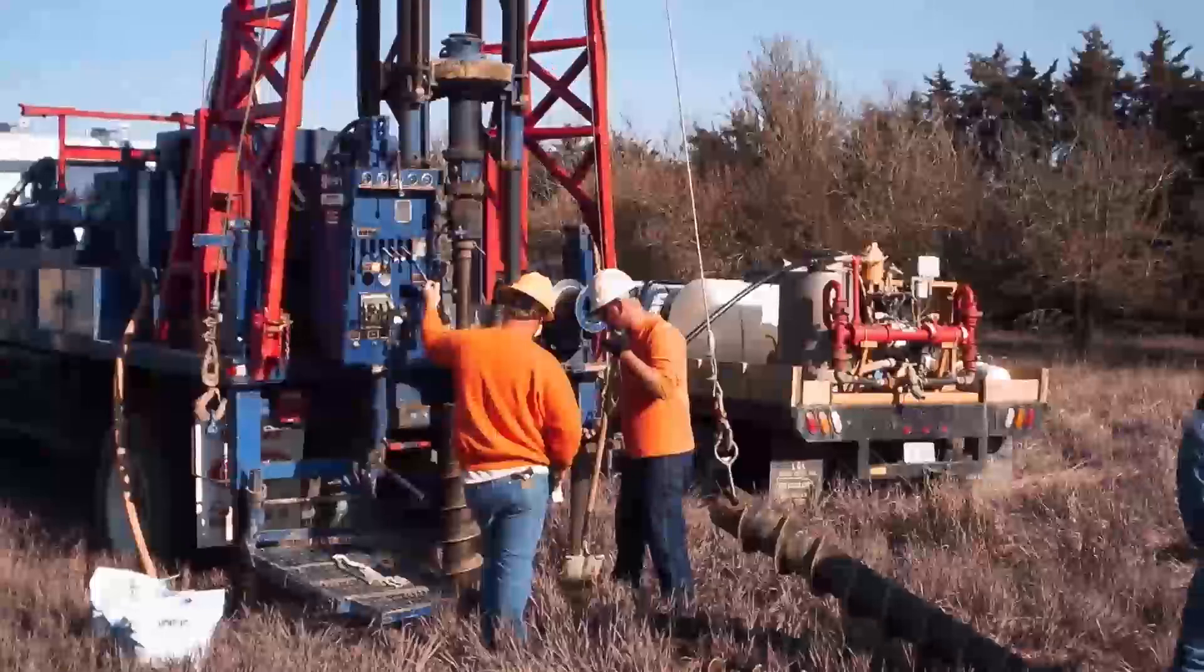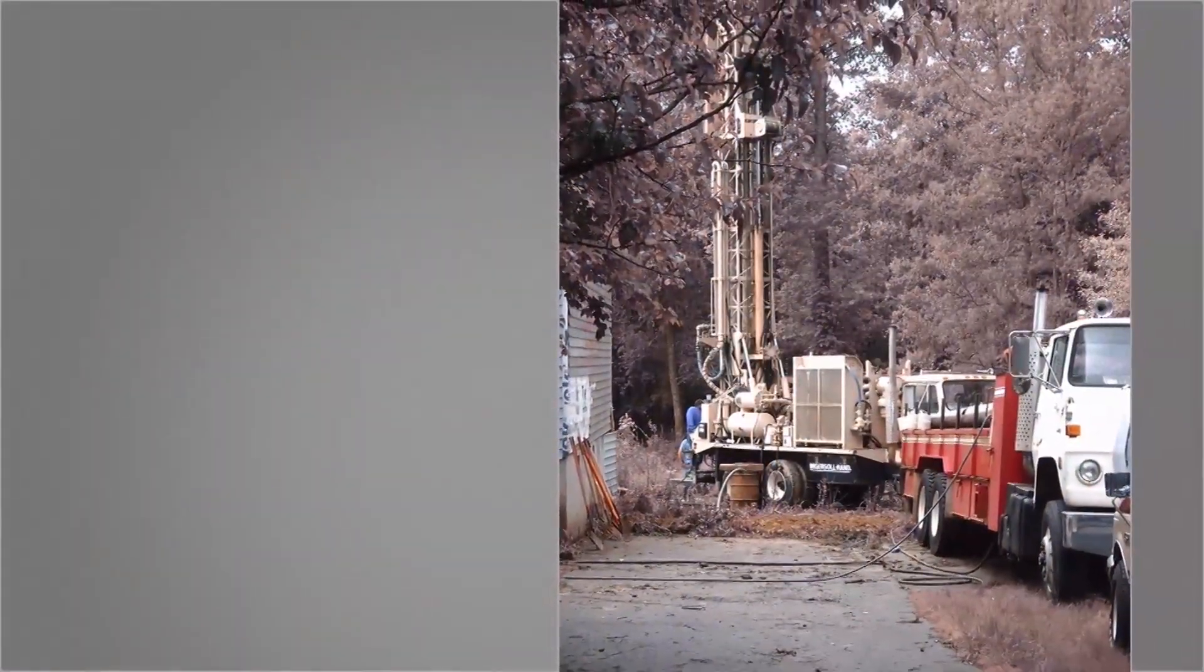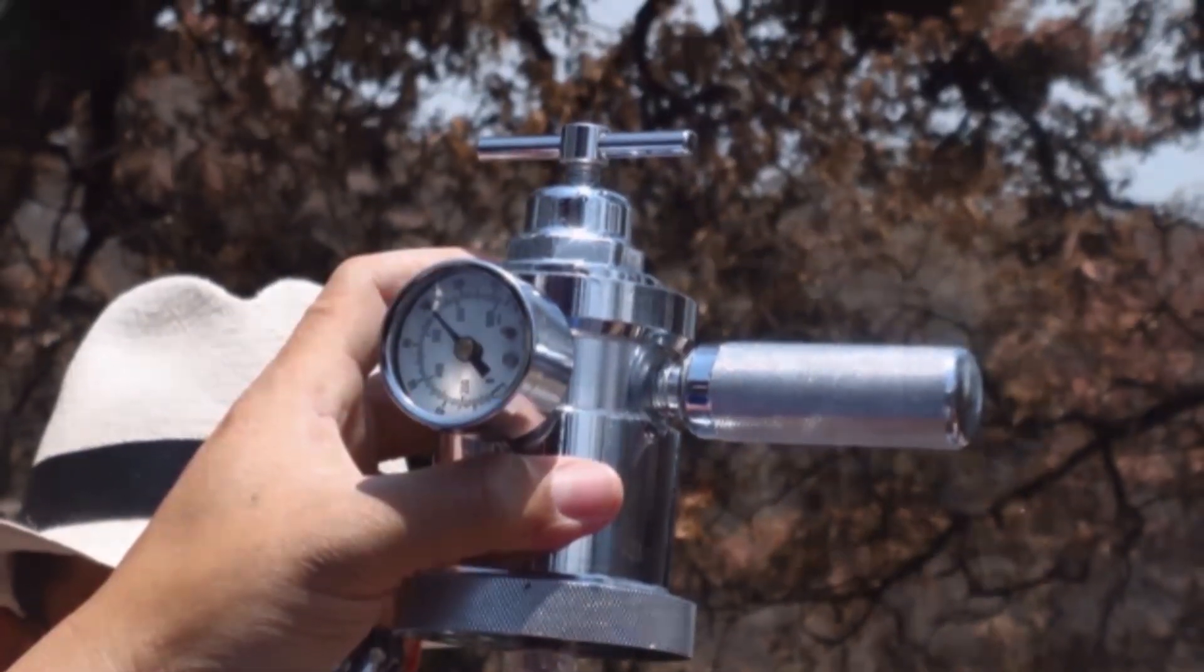One of the most powerful drilling fluid tests measures the property of filtration and includes the filtrate volume and filter cake thickness.